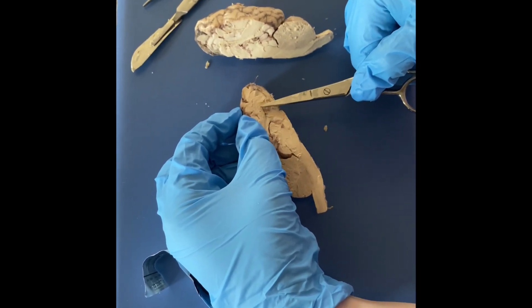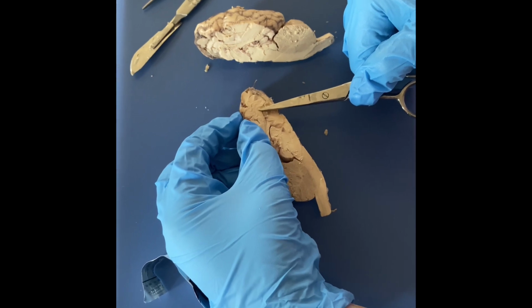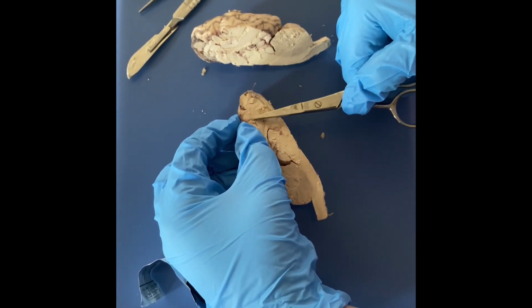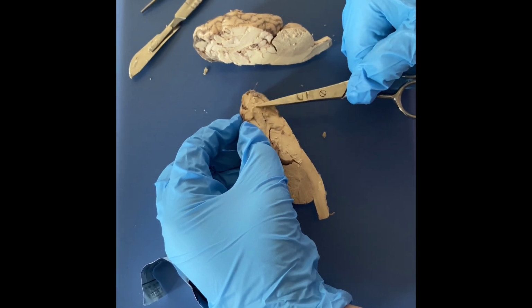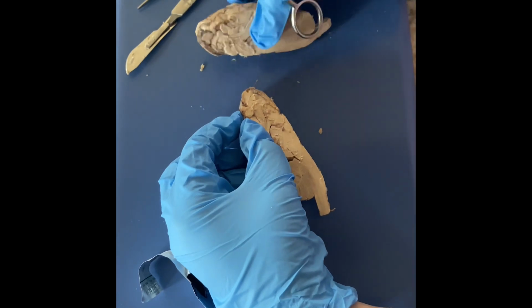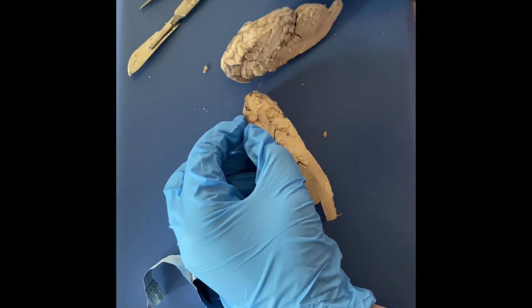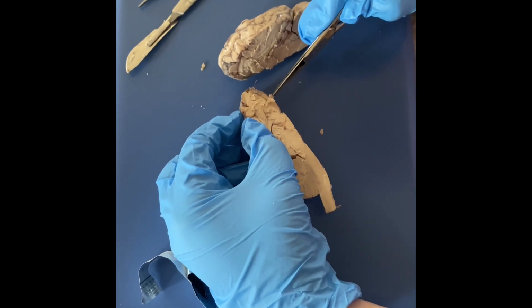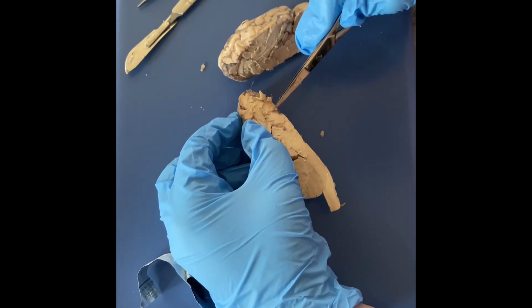Here is the sulcus. And then the inner one is the gyrus. It's kind of hard to tell, but there should be one here. That's the sulcus, and then a line, and then the gyrus. And then the olfactory bulb is kind of hard to find, but it would be kind of at the bottom here, and it would slope off a little bit.